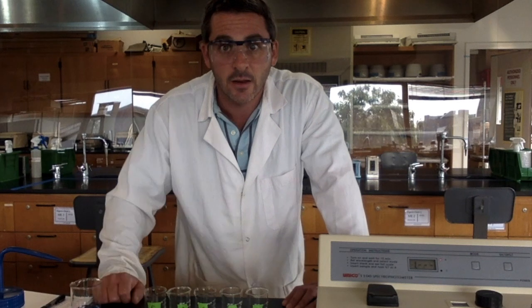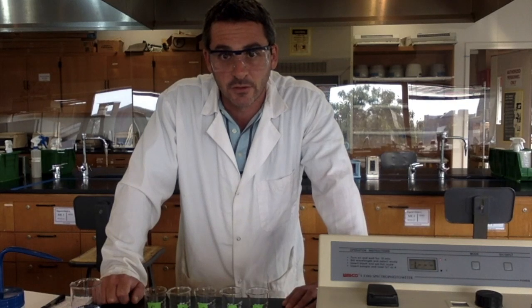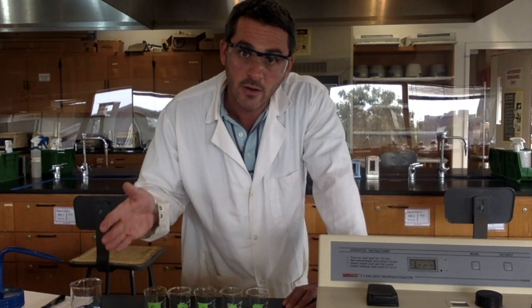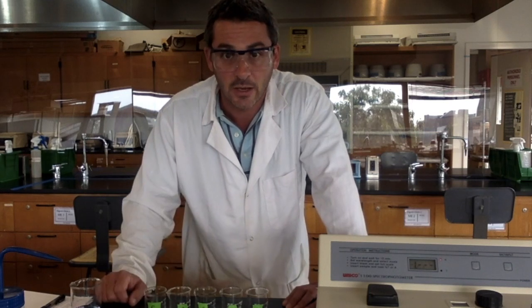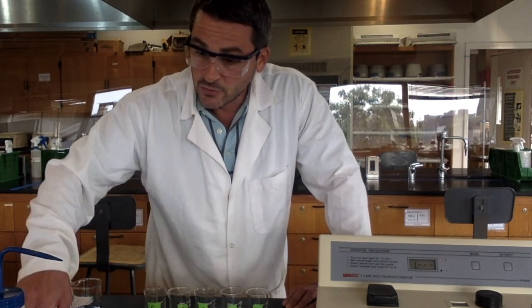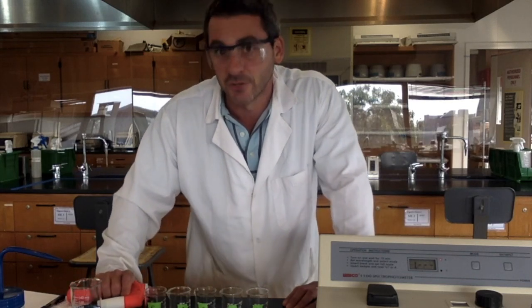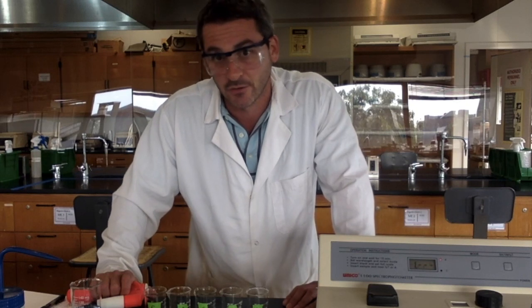The food dye has a concentration that we know. I'll go over that in the calculations, so I don't need to do that right now. But since we know the concentration of that, we can dilute this, and we will know the concentrations of our solutions, A through E here. Okay? To make the solutions, what we're actually going to do is called making a serial dilution. And no, I'm not talking about putting milk in your Captain Crunch.